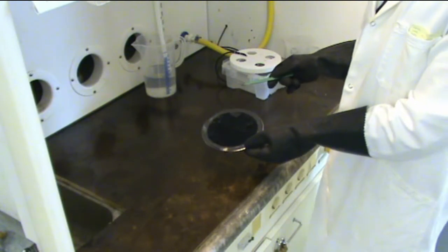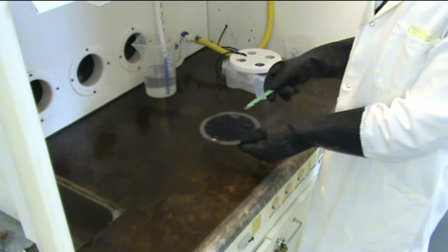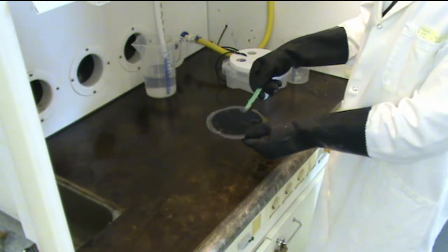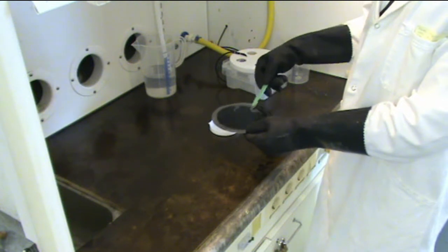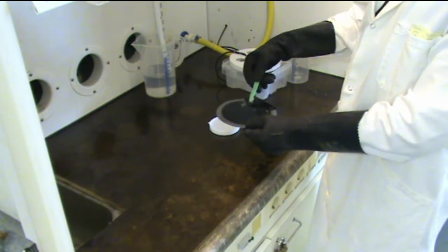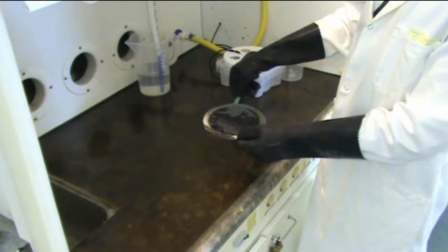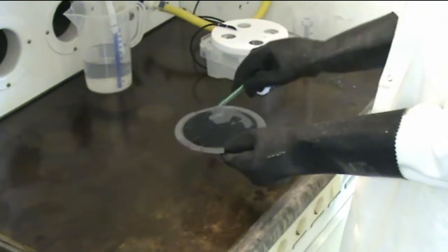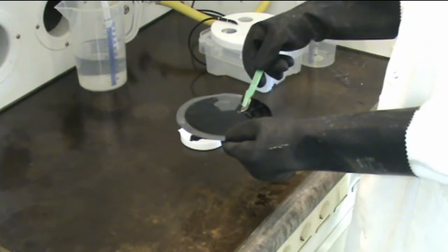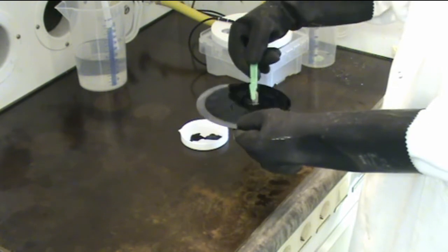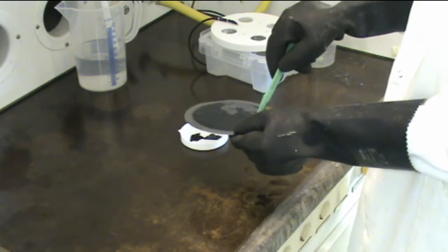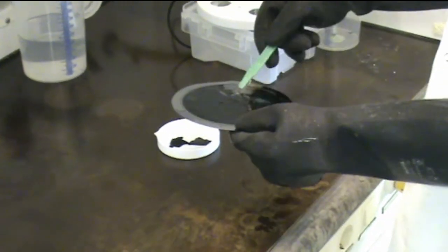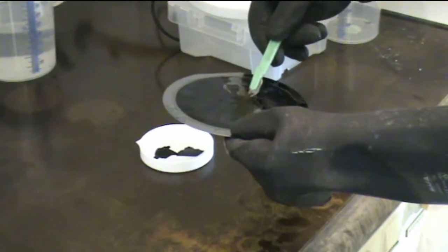And here we have the porous film that we just etched on the silicon wafer. And now I will remove the porous film.